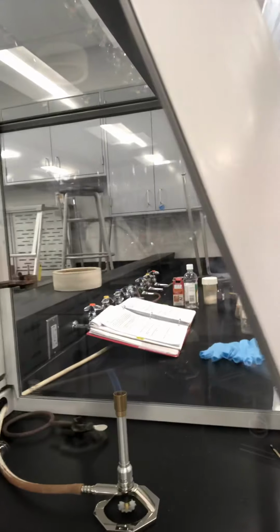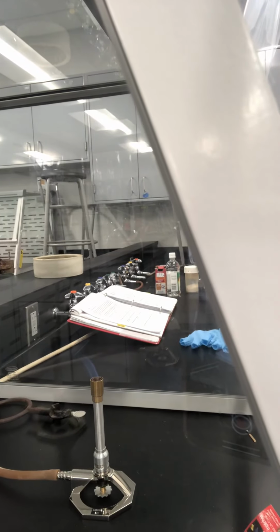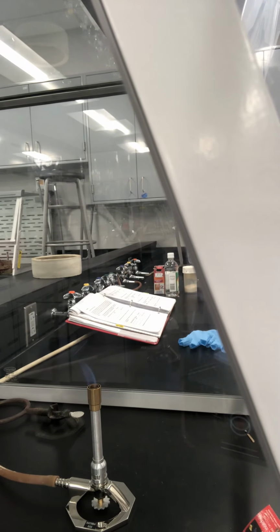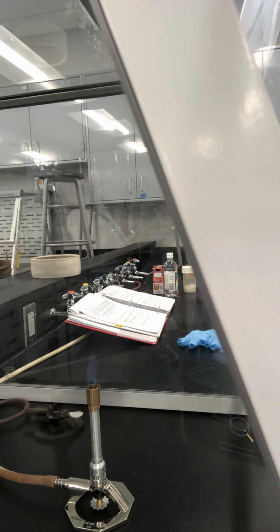Okay, this is the Bunsen burner, and in the previous video I already showed you how to use it, and what a hot flame and a cool flame are. Now I have already adjusted it to a hot flame, which has two layers. It has an inner cone. And I also told you before that the top of the inner cone is the hottest spot of the hot flame. Okay, let's do experiment A.